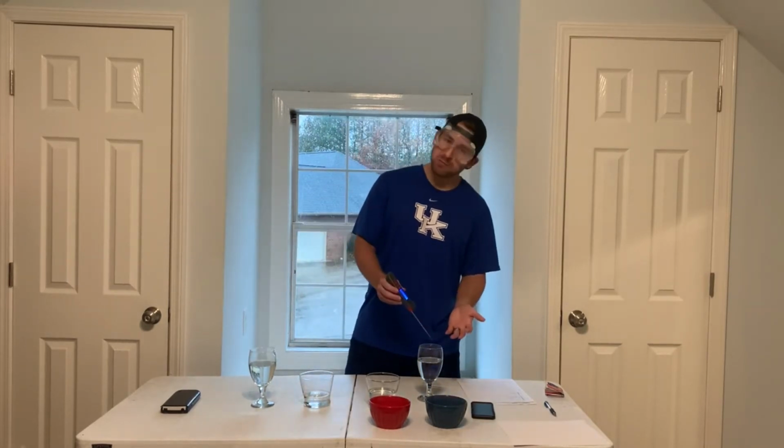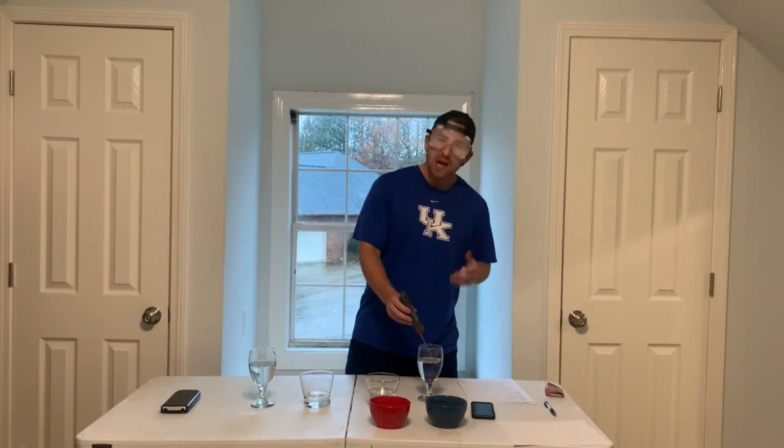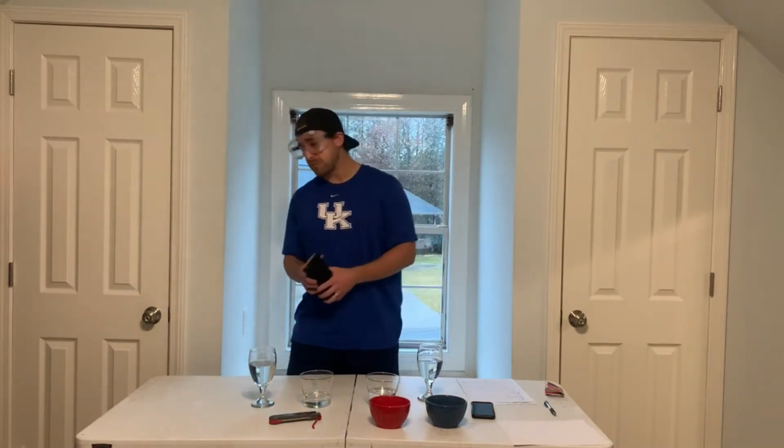Then you're going to take your thermometer again and take the temperature of the liquid with the additive still in there and record that temperature down as well. And we'll call that temperature our final temperature. Then, using your calculator, you'll get the difference between the final temperature and the initial temperature. If that difference is negative, or a negative number, then we know that the reaction was endothermic because heat was absorbed, thus lowering the temperature of the liquid.